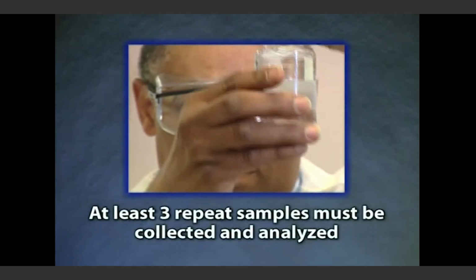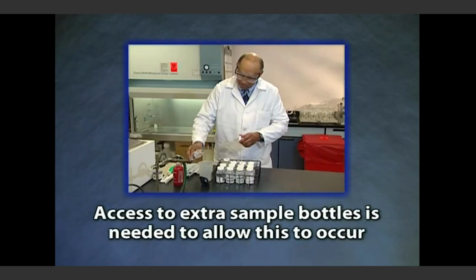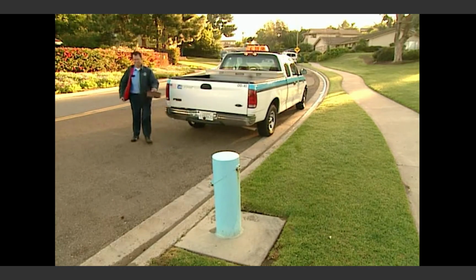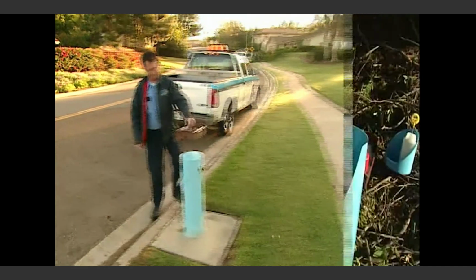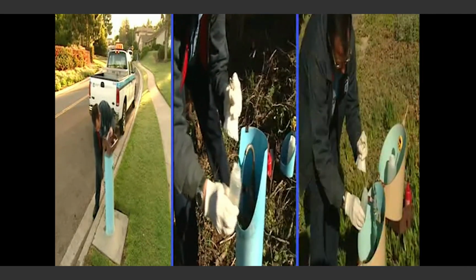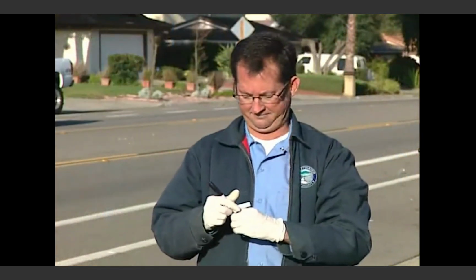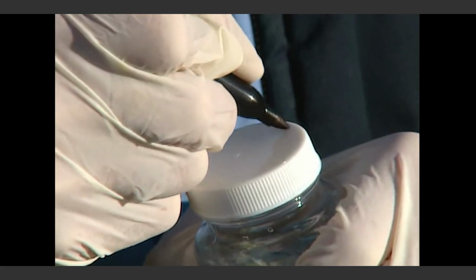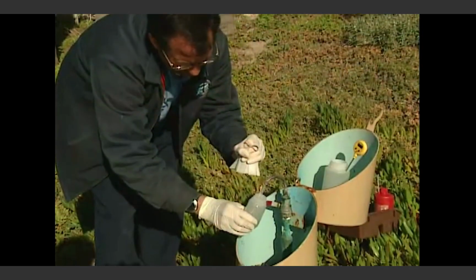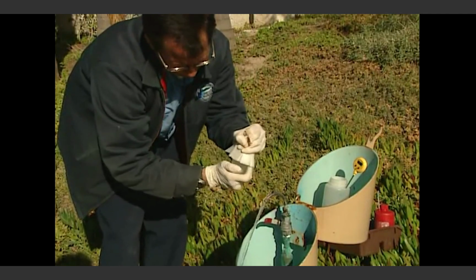At least 3 repeat samples must be collected and analyzed. Access to extra sample bottles is needed to allow this to occur. 1 repeat sample must be collected from the same tap as the original sample. Another must be collected within 5 service connections upstream, and the third from within 5 service connections downstream. Clearly label each sample. Repeat sampling does not confirm or deny the original positive coliform sample. It is designed as follow-up action to make sure that nothing more serious is happening at that location in the distribution system.